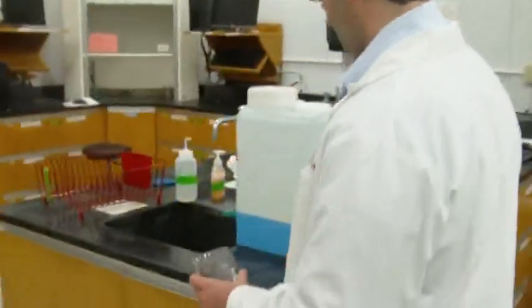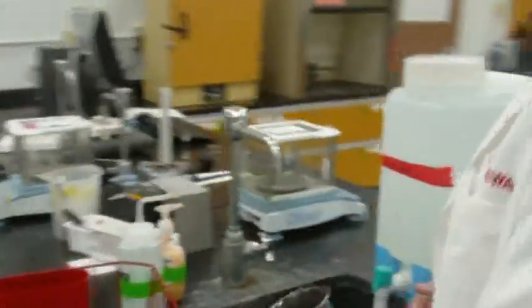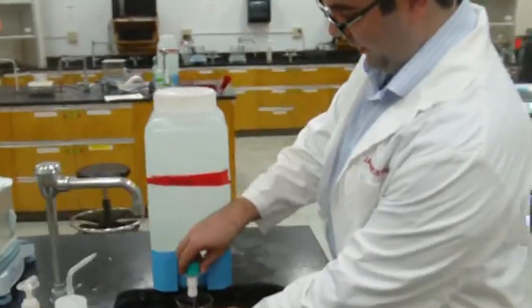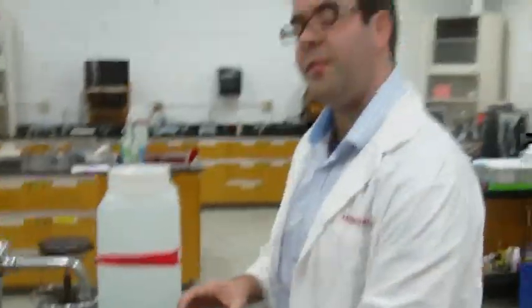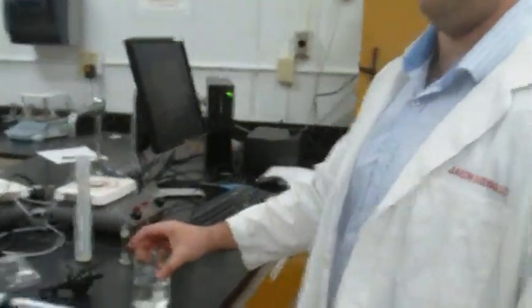Okay, first we need to get some water. Okay. Go over here. Does it matter which water you use? Yes, we want to use the deionized water. Okay. What's in the other water? Other salts and minerals that could change the mass of water. Okay. We want to use as pure water as we can get. For this lab, it's probably not nearly as important as the next labs, but we always use the deionized water, right? Right. Okay.